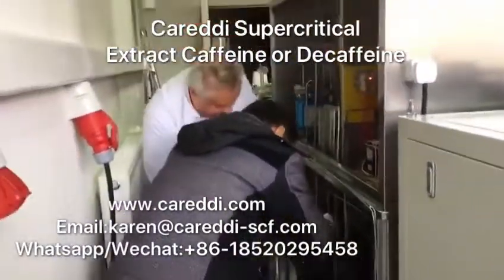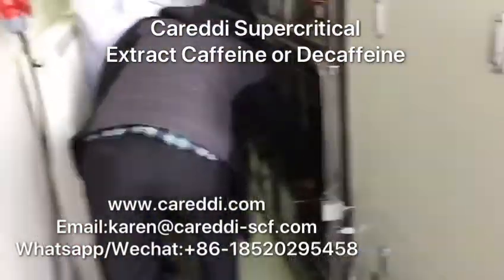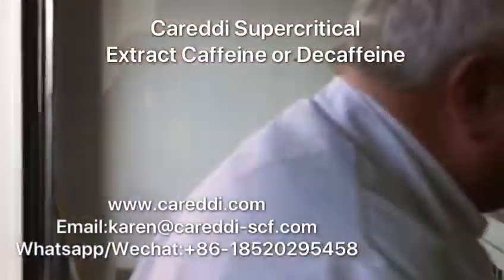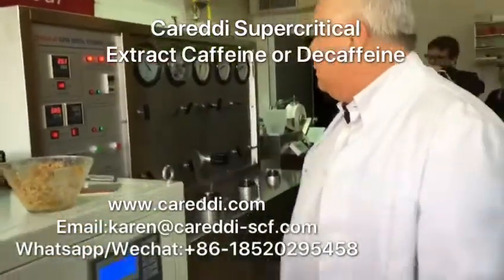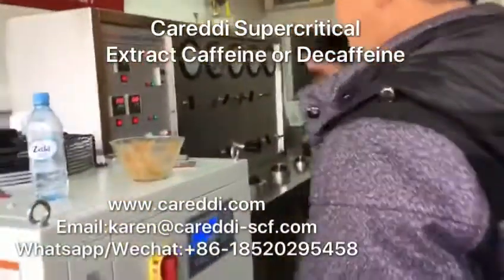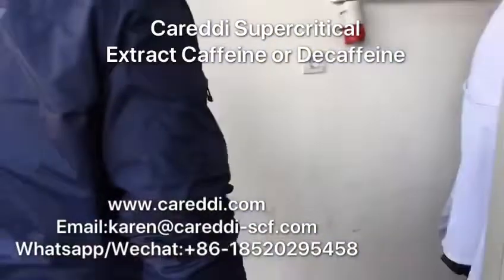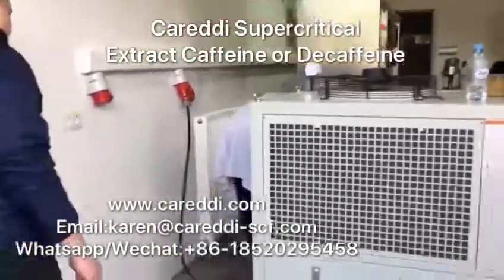I see that — okay, water okay inside, super. And then we go. Step two: we wait a minute for the temperature. Okay, and we go to the next step. Check this — water is inside.